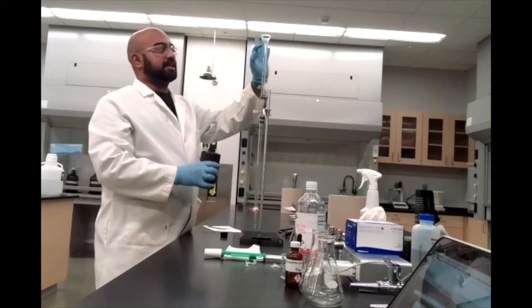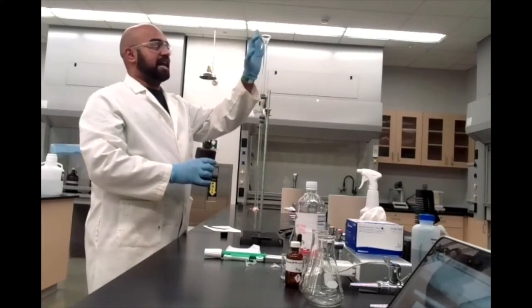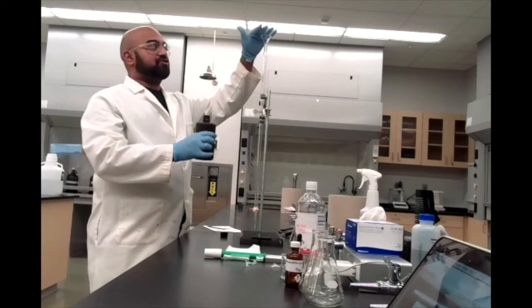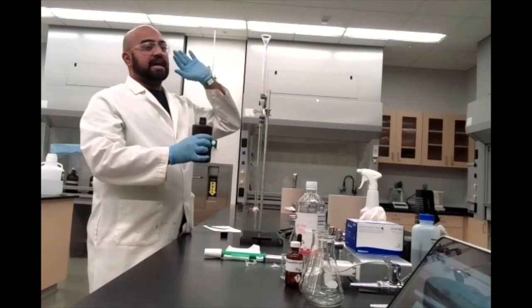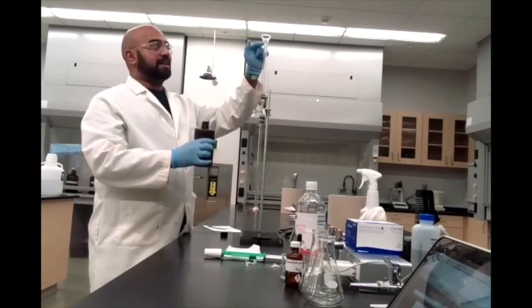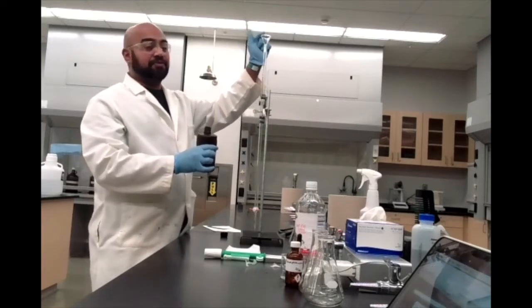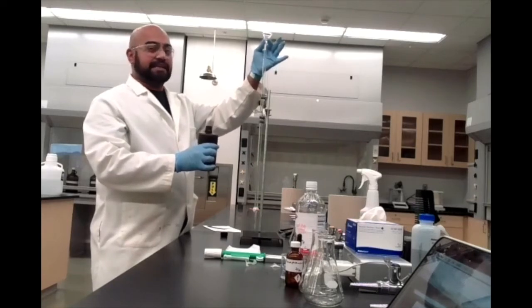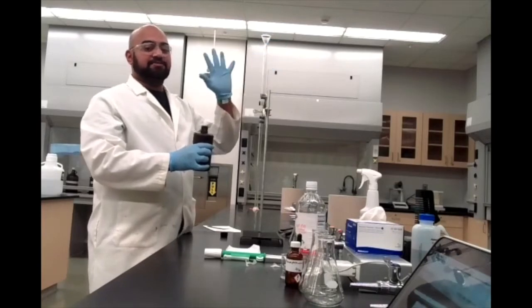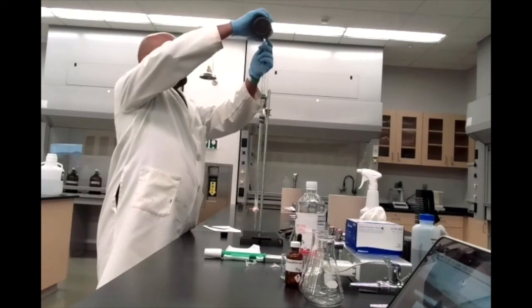I find that given the narrowness of the bore of your burette, if you just pour in your sodium hydroxide with your funnel just sitting here the way it is, it tends to not allow the air that's in your burette to escape, and so you tend to overflow from the funnel itself. I find, therefore, it's easier, or probably better, to just lift this up very, very slightly when you're pouring. Okay. Again, this is why it's good to wear gloves when you're doing this. All right. So let's go ahead and pour in our sodium hydroxide.